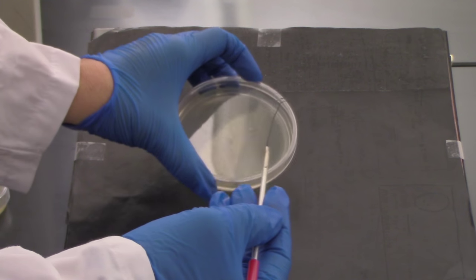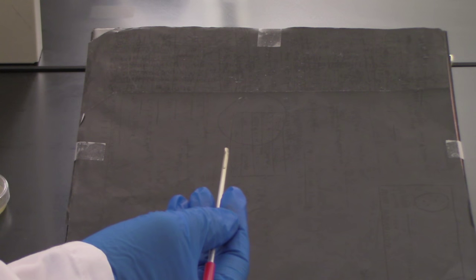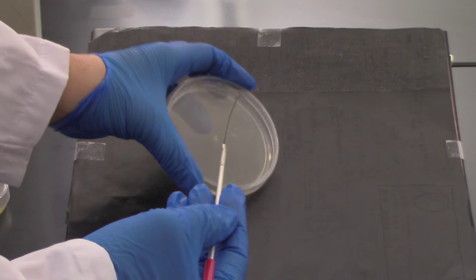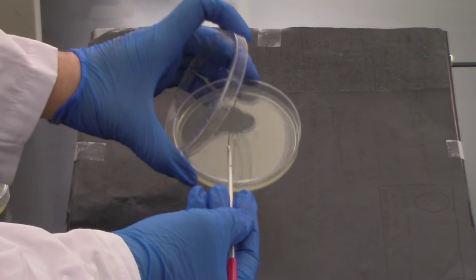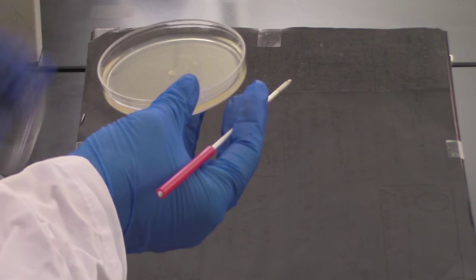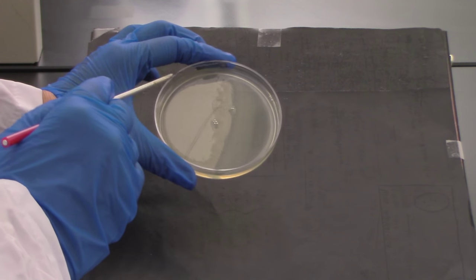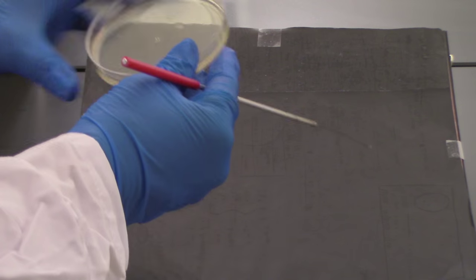I'm going to go to my petri plate. Remember you want to notice where the agar is — look for that cloudy agar medium on the bottom. That's where we're going to be depositing our bacteria; we don't want to put it on the lid. I'm going to remove the lid here just so you can see it better on the video, and I'm going to do my one centimeter vertical smear, then put the lid back on.